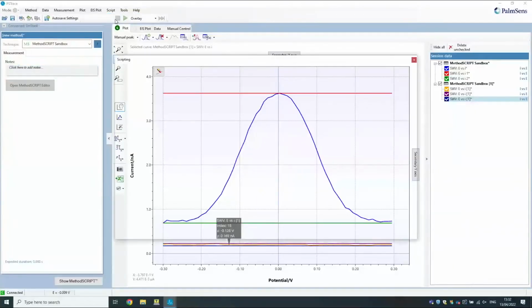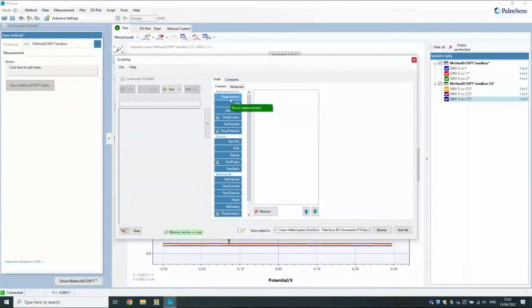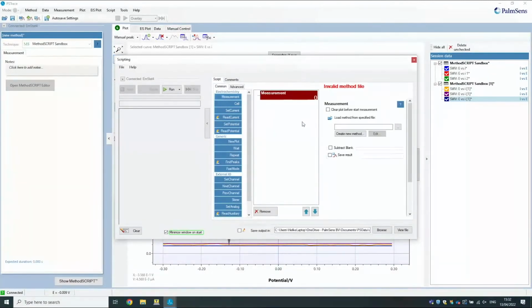Then you can use the scripting window. So you would, in PSTrace, click on script and then open script window. Maybe it's good if you can show it on the screen. Okay, I certainly can. So this is the scripting window, and it works a bit like Lego. This is not real programming, like even I can do it.